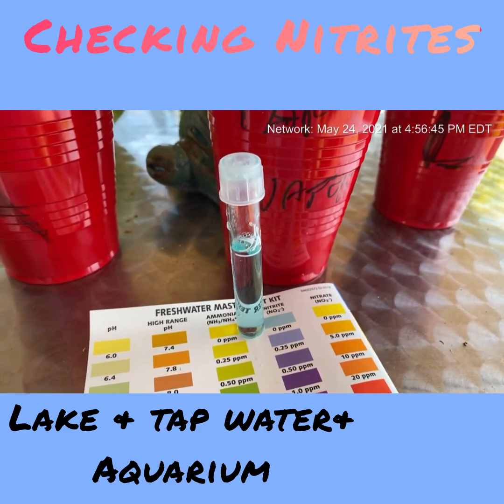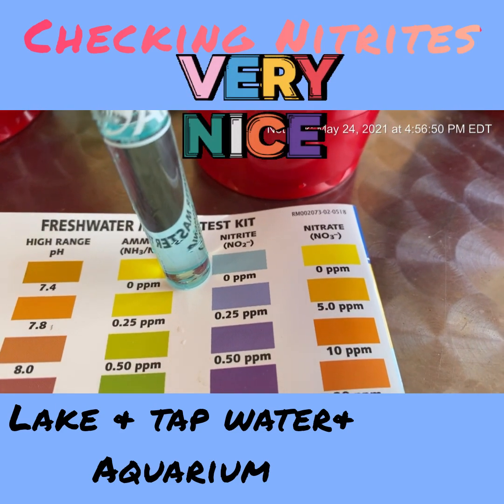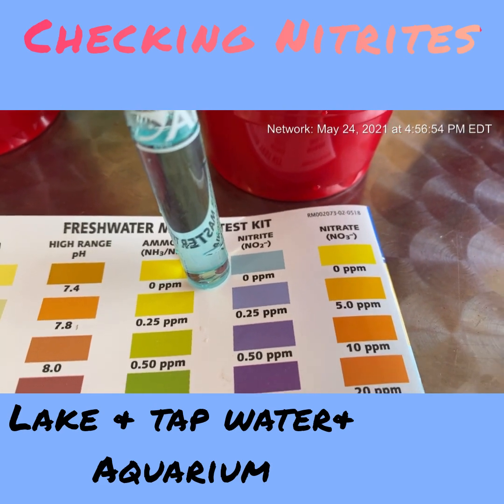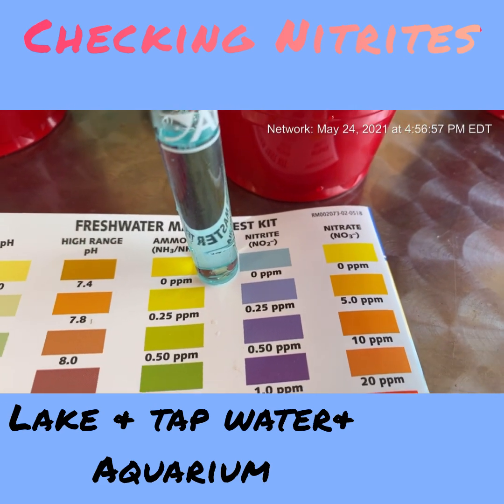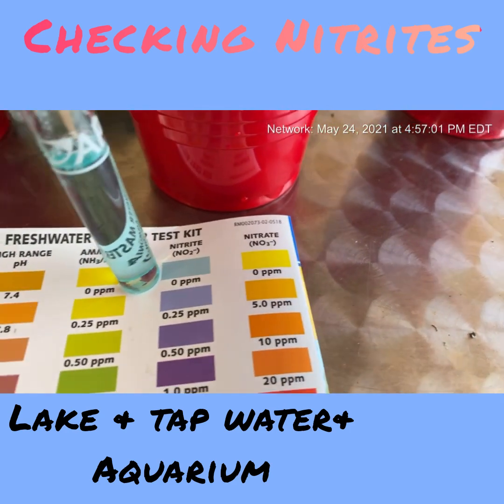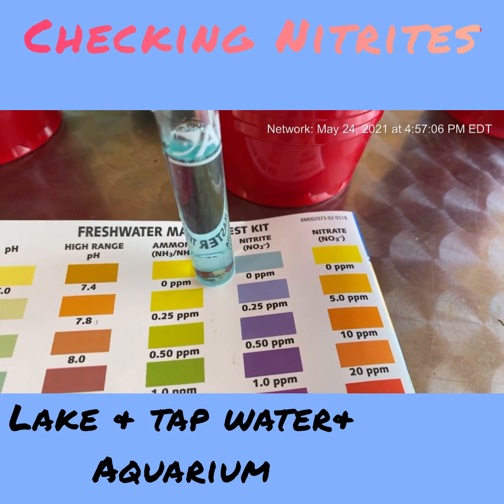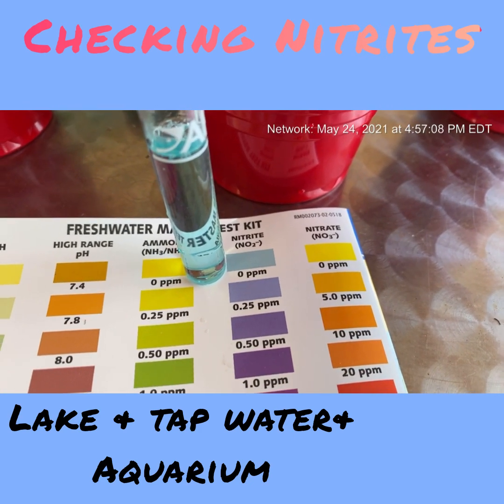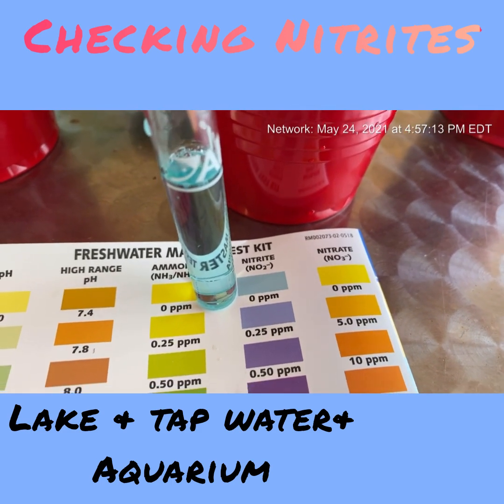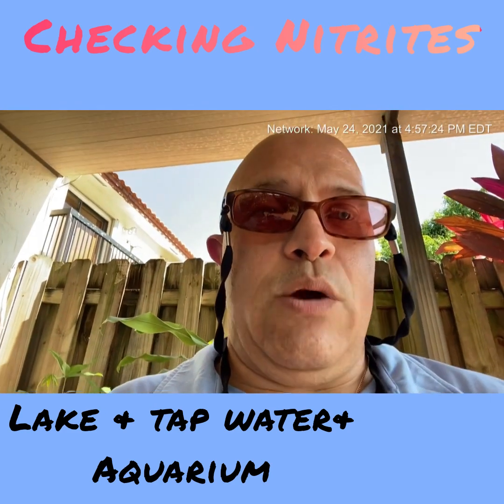We're testing the lake water first, and according to my test, there are no nitrites at all in the lake — it is completely free of nitrites. Remember, I thought nitrates and nitrites were the same, but they're not. The lake being nitrite-free explains why there are so many fish living in it. No nitrites in the lake!